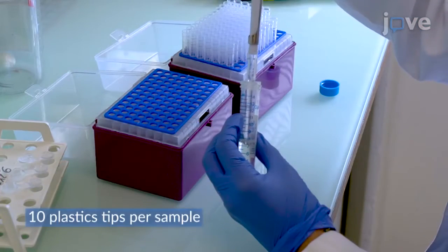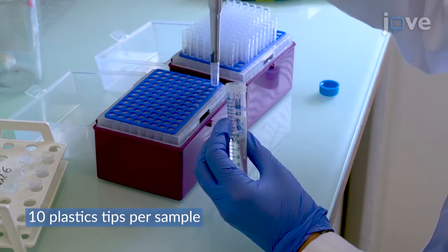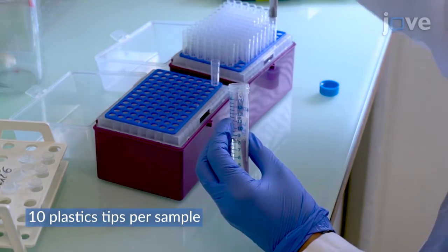To coat the pipette tips, pipette 5% BSA solution two to three times and air-dry them for two hours.